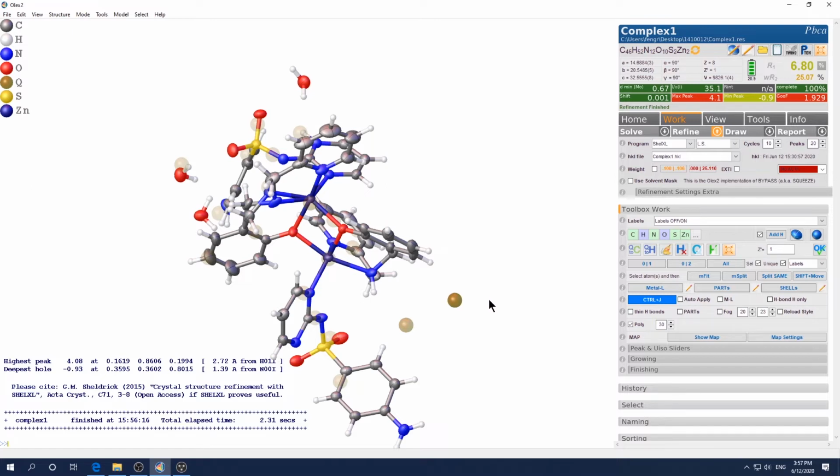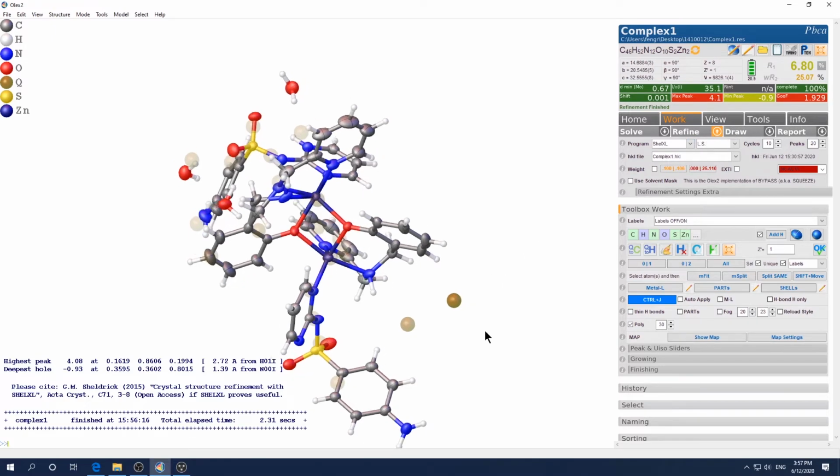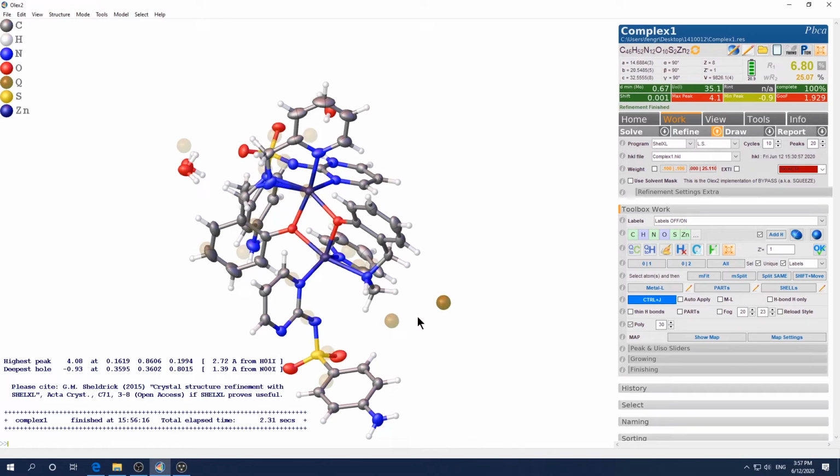So the alternative to solve that problem is actually using the solvent mask or squeeze method called BYPASS. So this is a great opportunity for me to show that. That's why I actually did not try to model this at all. So the way to do it is here, very convenient. Right below the refine, you see this use solvent mask. Okay, so let me give you a brief explanation how to use this.